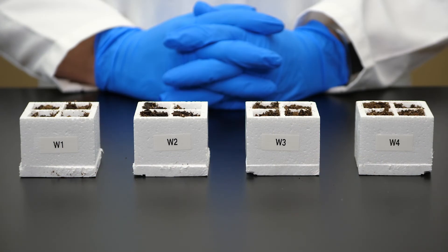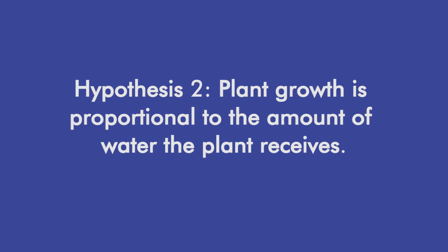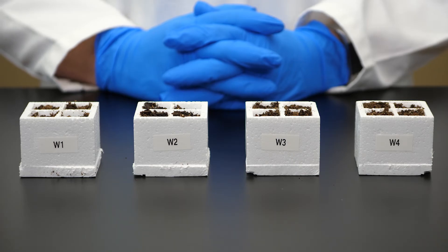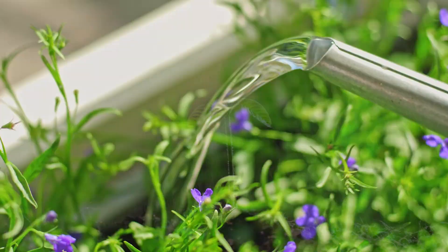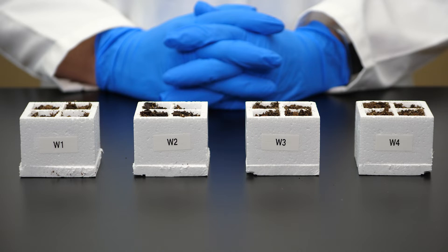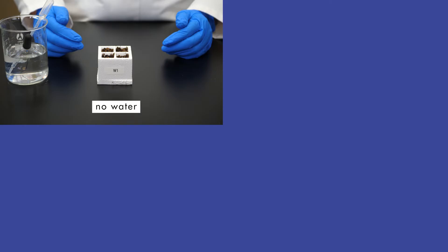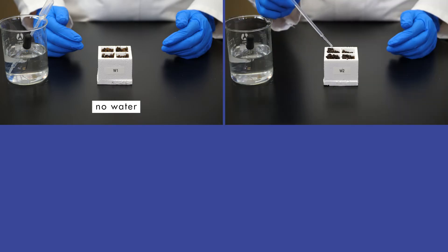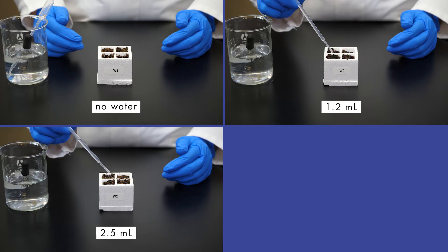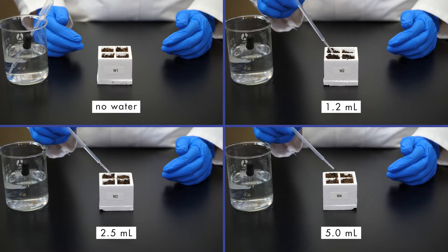In the second experiment, we will conduct a test to prove or disprove this hypothesis: plant growth is proportional to the amount of water the plant receives. We will use four groups of plants. Each group will receive the same amount of light and nutrients, but the amount of water is the variable, measured in milliliters. The outcome is plant growth, again measured in average height. Group W1 will not receive any additional water after the seeds are planted. Group W2 will receive 1.2 milliliters per day per plant. Group W3 will receive 2.5 milliliters per day per plant. Group W4 will receive 5 milliliters per day per plant.